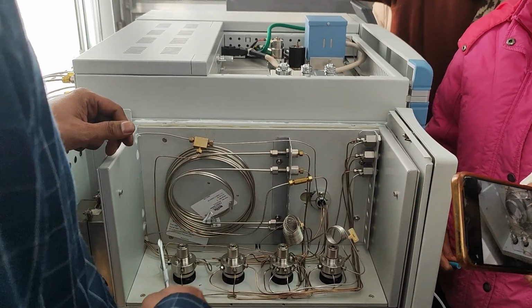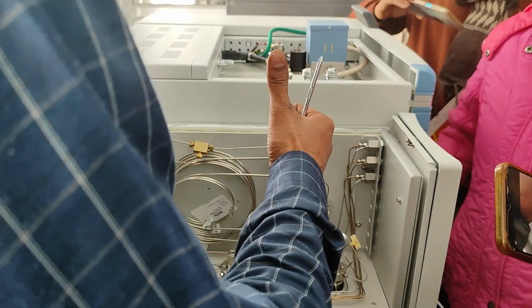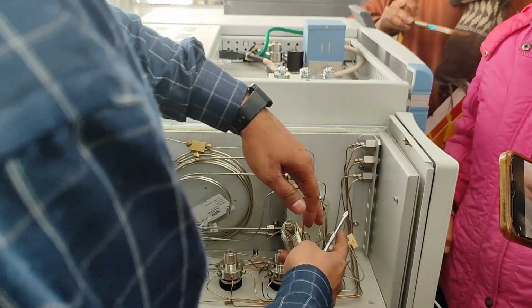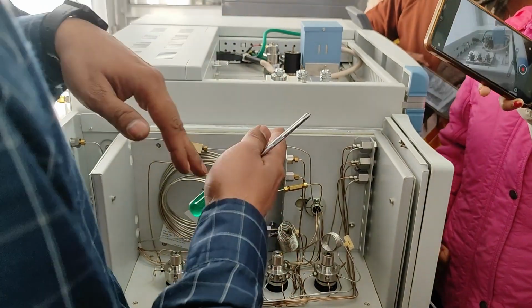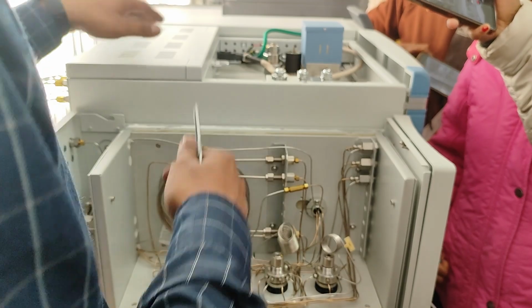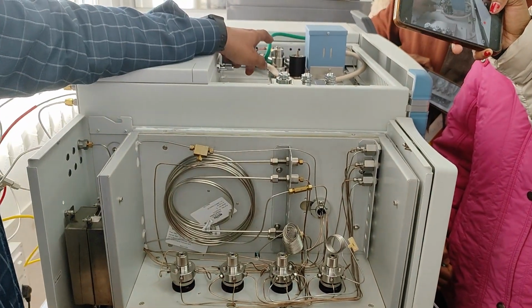So it's multi-channel. You see multiple loops are there. When you press inject, this loop's part will go to the TCD, this loop's part will go to the ECD, in a separate way. In a single injection, we can use multiple detectors. 3 detectors can be used in the same injection.